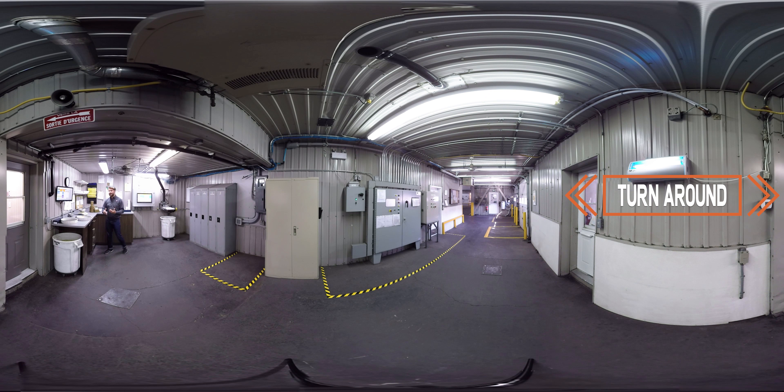Then a really important test: our GMO strip test, just like this one. And this one's negative.